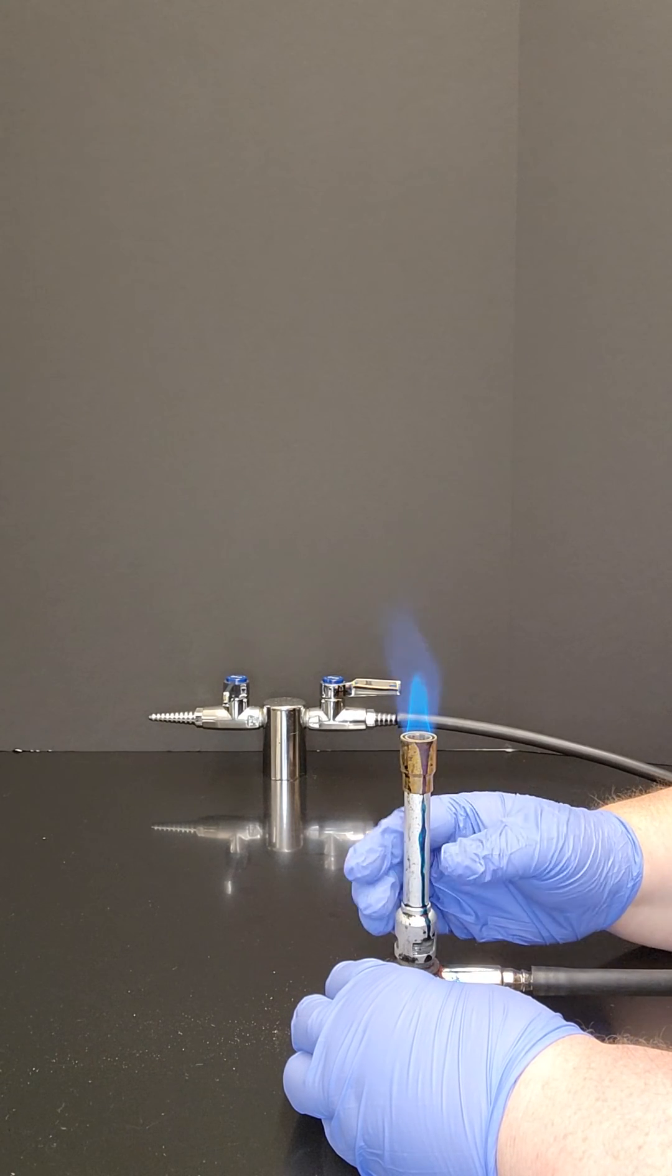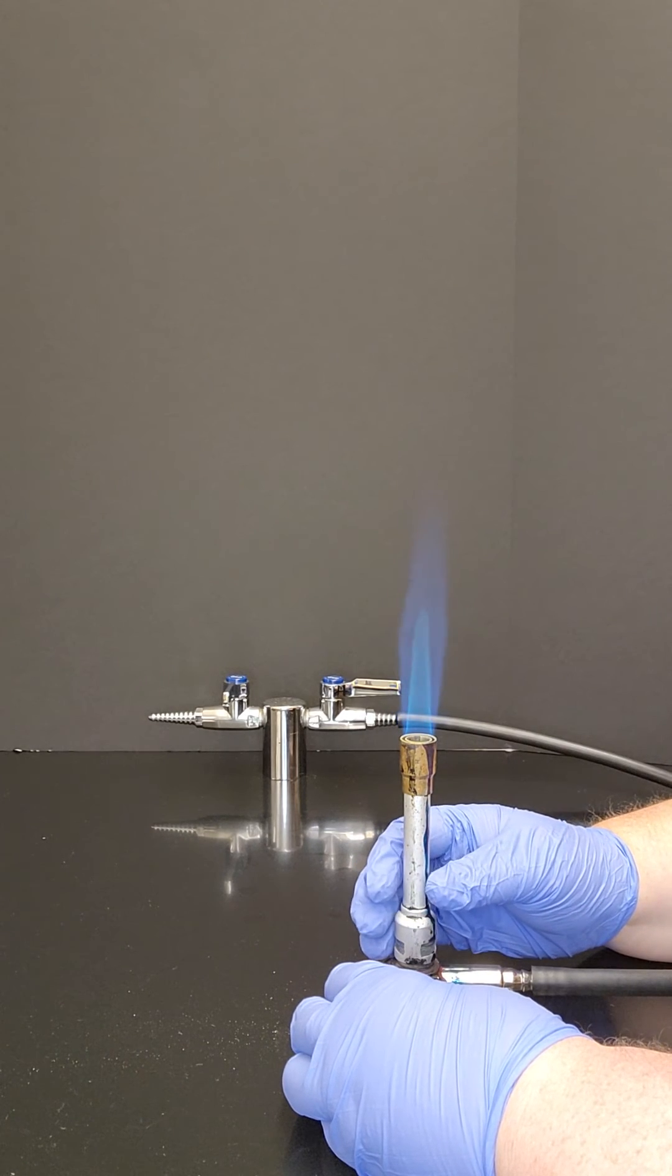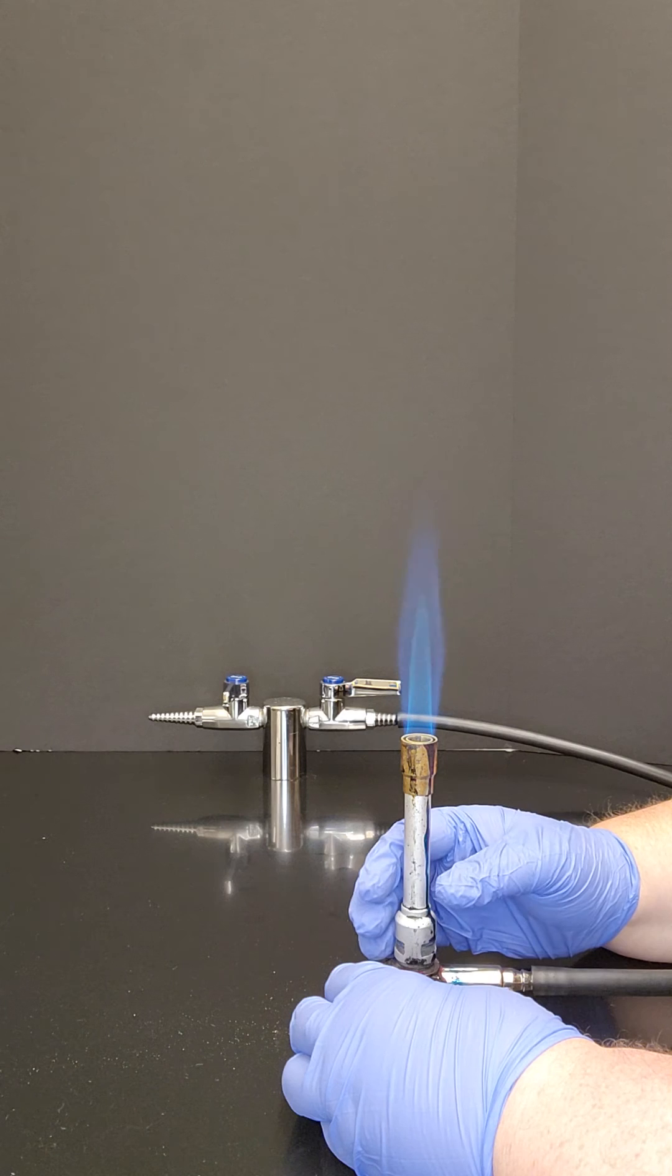Turning this adjusts the amount of air you get. Turning it to the right shuts off the air supply. Again your flame will get sloppy.